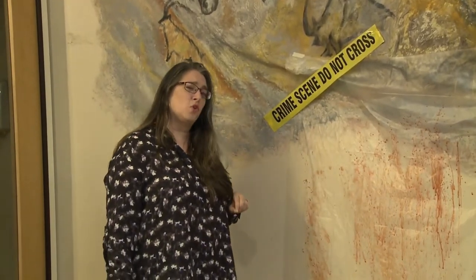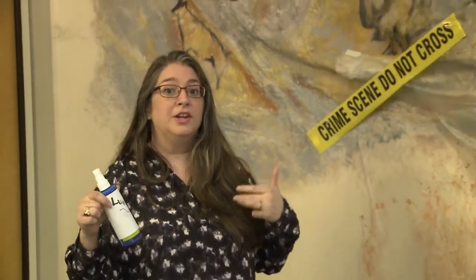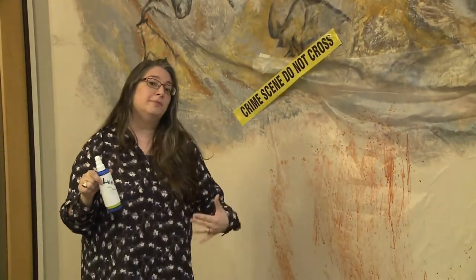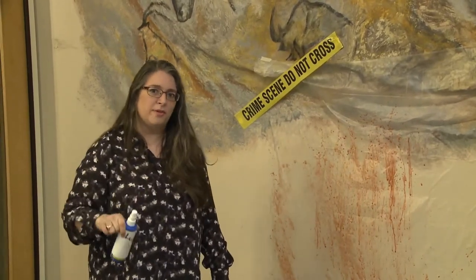If these questions ever cross your mind, well never fear. Luminol is here to help you ID all those pesky signs of murder and mayhem, and I'm here to show you how it works. So come join me in my luminol lab where I'm making it nice and dark. You'll see why. Let's go there now.